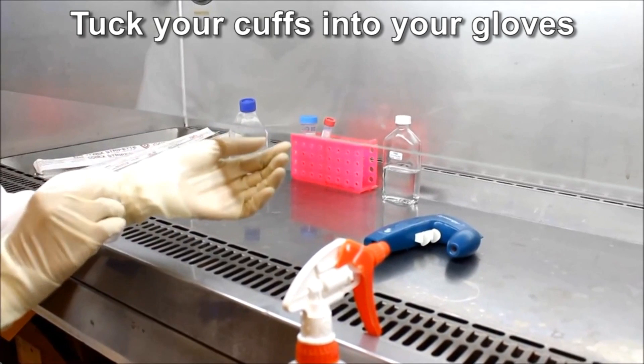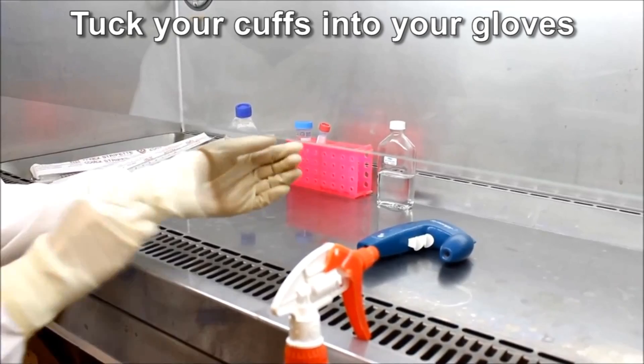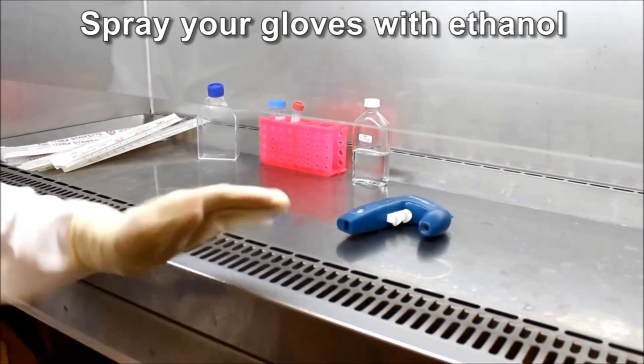Make sure your cuffs are tucked into your gloves to decrease the chance of contamination from skin cells or lab coat fibers, and that you have sprayed your gloves with ethanol.